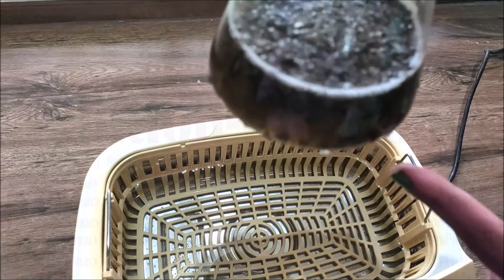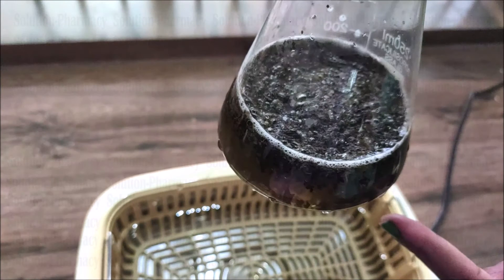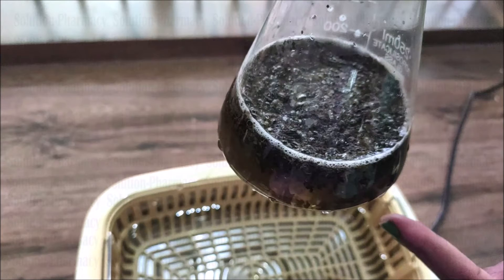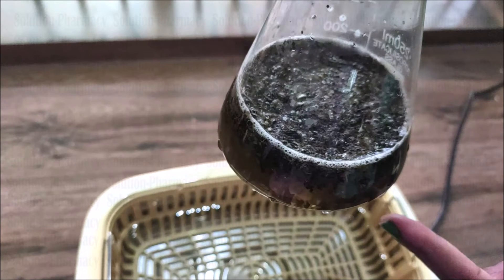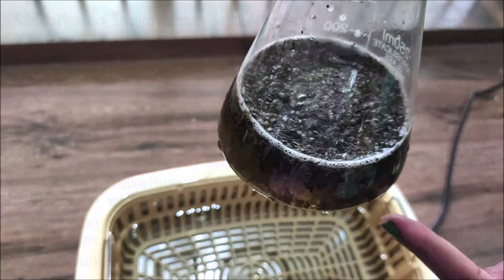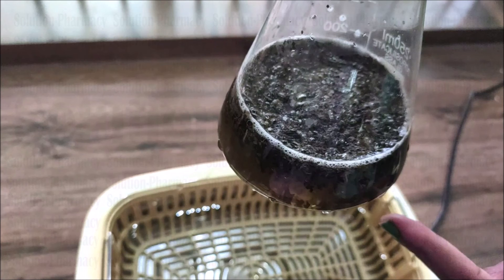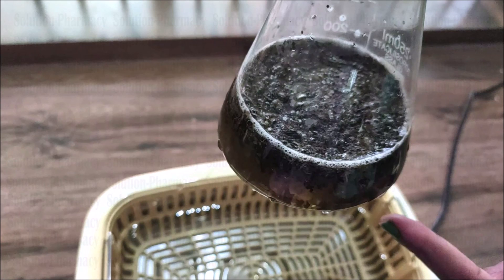Here you can see that in the lower side of the flask, the solvent — water in this case — is now dark brown in color due to the solubilization of the chemical constituents that have been separated from the plant material into the solvent by the ultrasonication method. So this is how we can operate the ultrasonicator for the extraction of plant material. Thank you very much for watching this video.